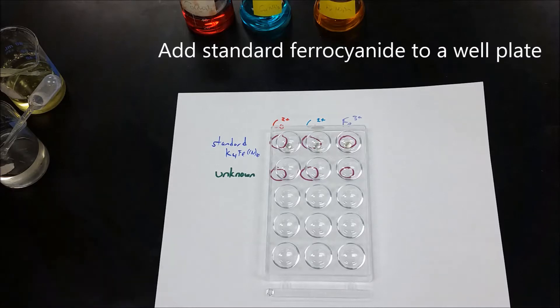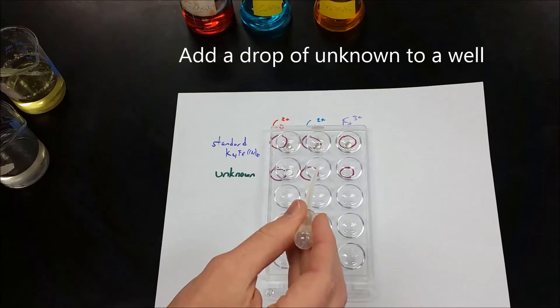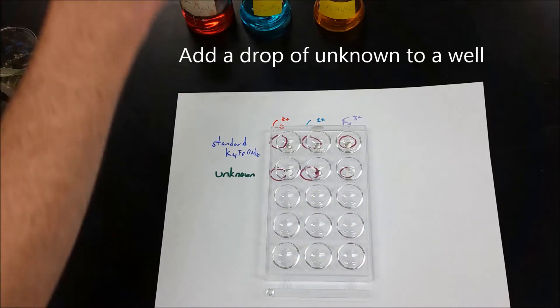I'm actually going to show you all three at once, and then we would compare that with our unknown. So we're going to put our unknown into three different well plates, and you can pick whichever one you want. I'm going to show all three.